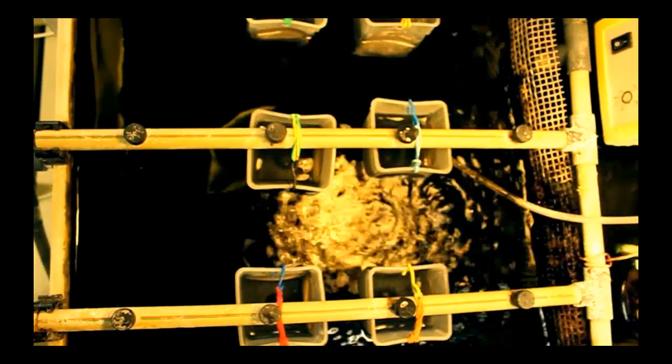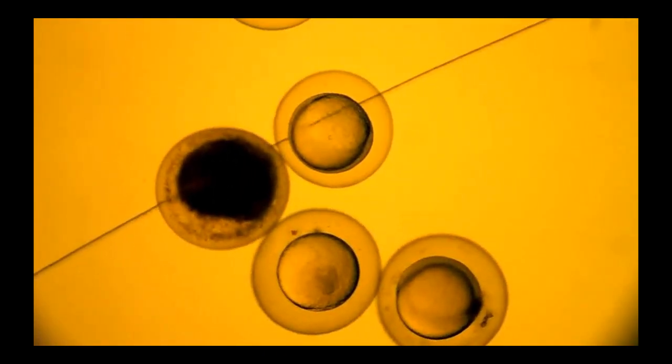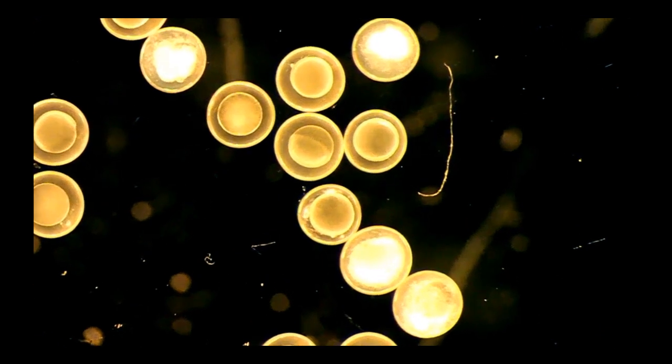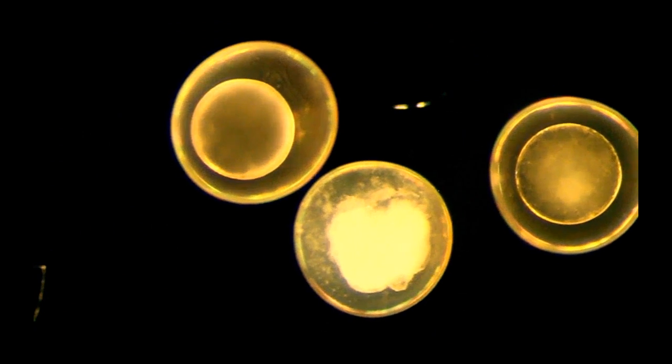After 10 hours, unfertilized eggs have to be displaced to prevent fertilized ones from being infected. Unfertilized eggs can be easily removed with a pipette as they appear cloudy and brighter through the microscope.